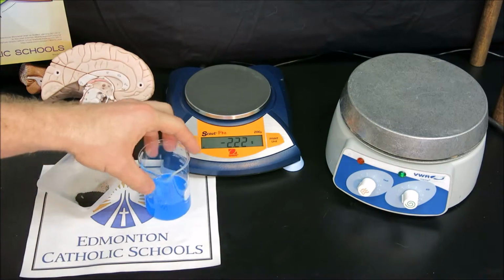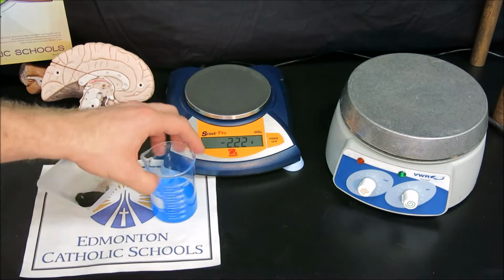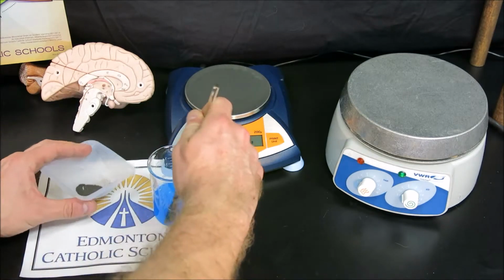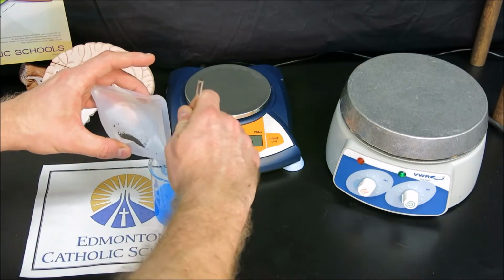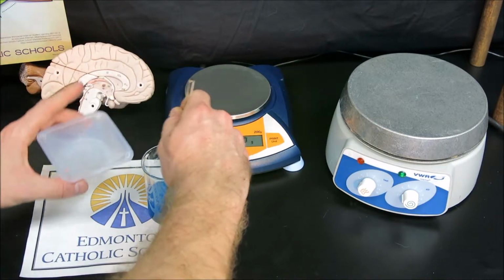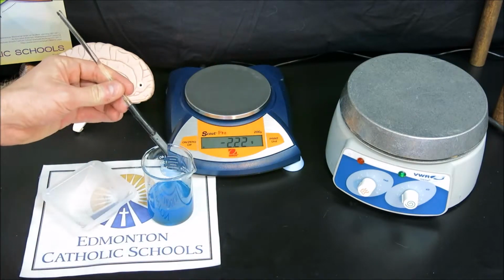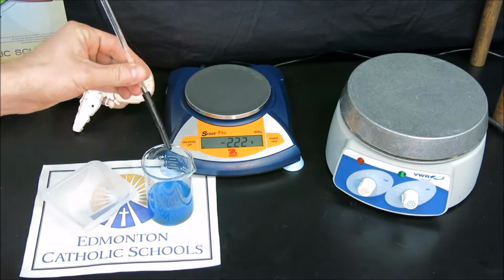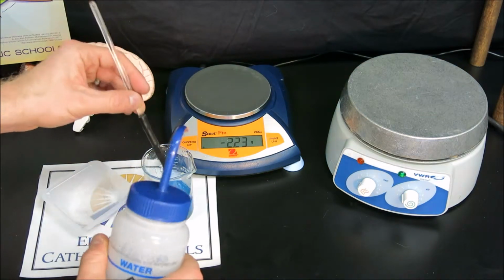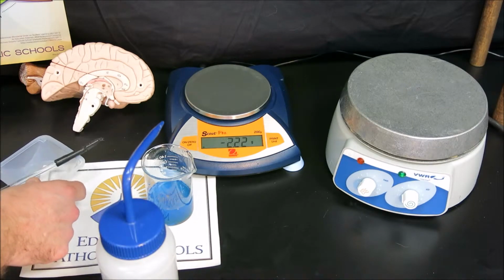Now what we can do is take our iron solid and add it to our copper-2 sulfate solution, slowly stirring as we add it in. And once it's all mixed in, we'll stop stirring and allow the newly formed particles to settle. If you see any solid on your stir rod, make sure to rinse those quickly into the solution, as every single piece will be weighed and be used to calculate the moles of the product formed.